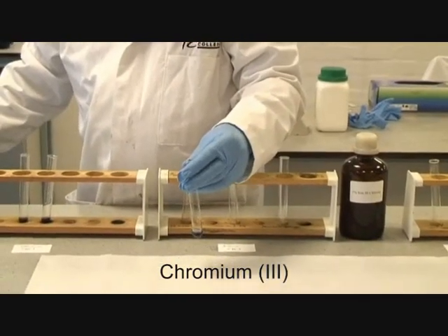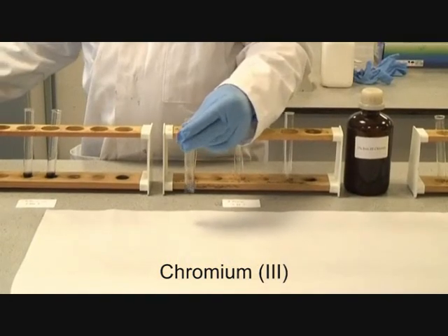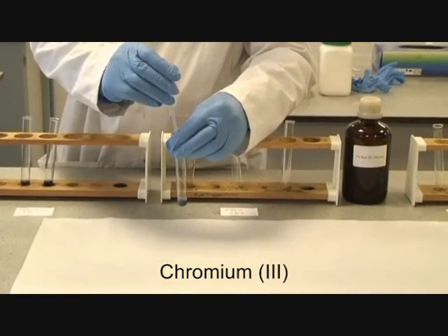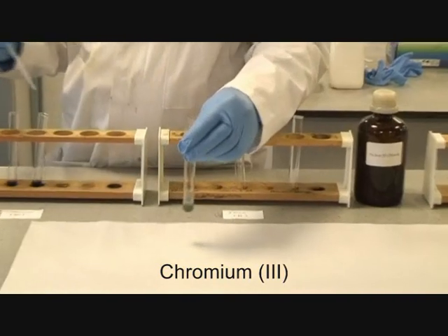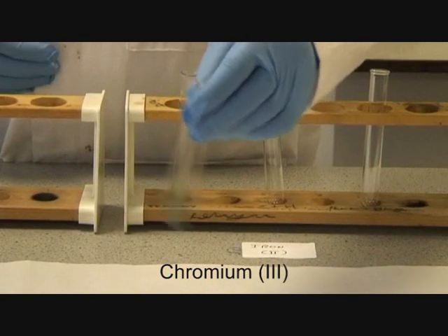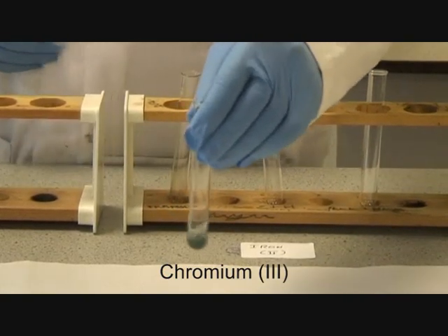We're now going to add sodium hydroxide to this. This is a one molar solution of sodium hydroxide — note what happens. As you will see, you have formed a greeny-gray precipitate. You must identify what this is.